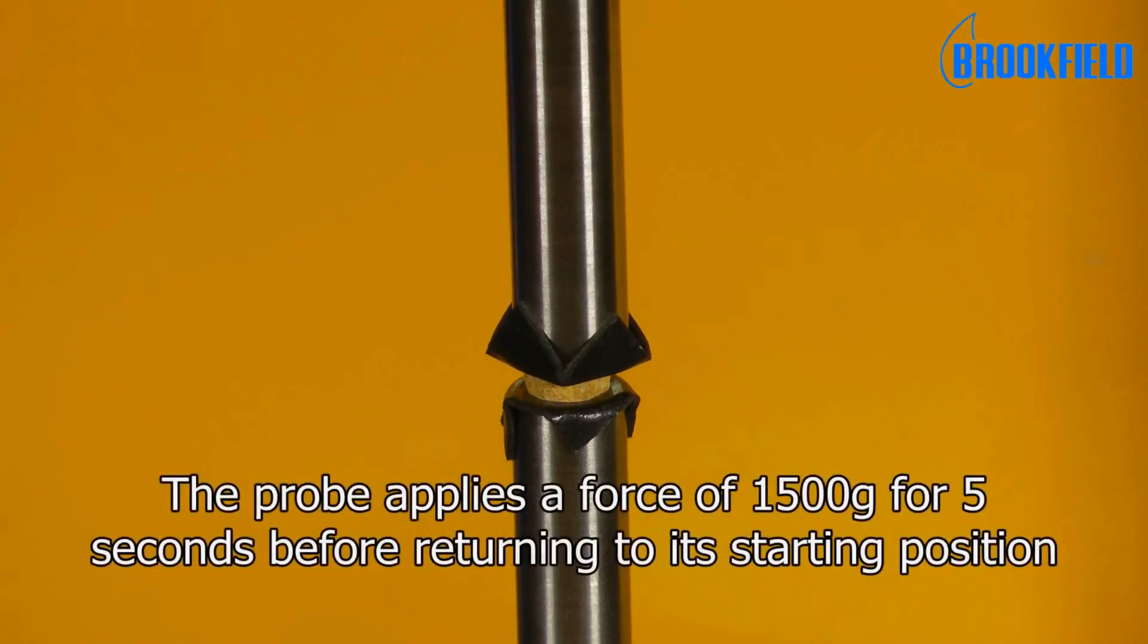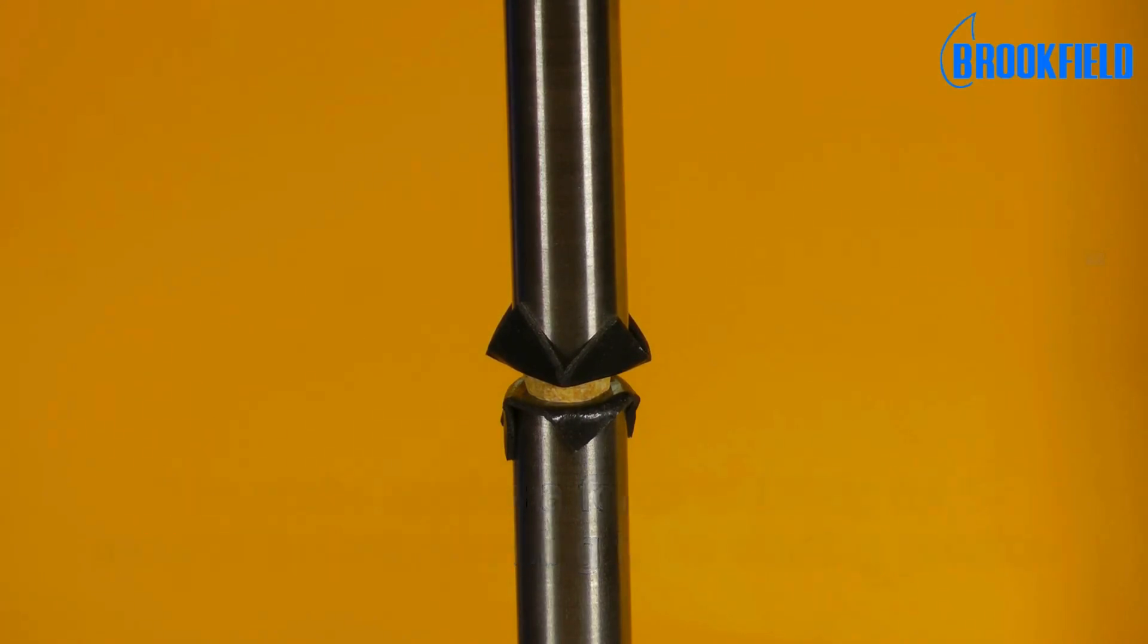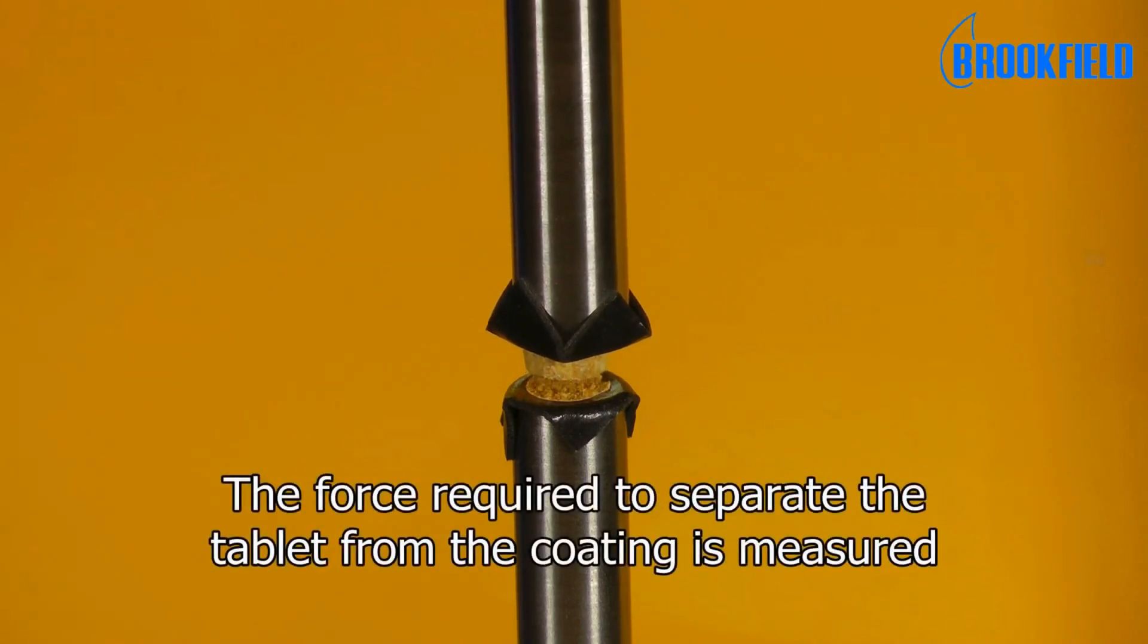Here the probe applies a force of 1500 grams for 5 seconds before returning to its starting position, and the force required to separate the tablet from the coating is measured.